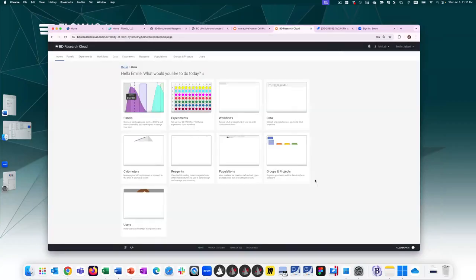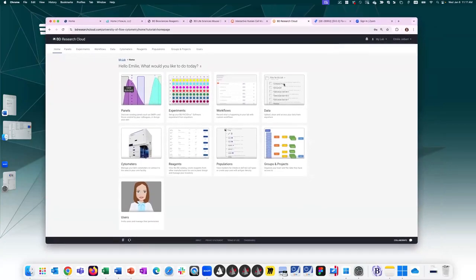Okay, so by logging into BD Research Cloud, you arrive on the homepage. The homepage shows different tiles of the different sections. So there's a lot you can do within BD Research Cloud. Today, we're going to focus on panel creation, but just very briefly, you can not only view and create panels, but you can create FACS-DIVA experiments away from the cytometer. You can create customized workflows to keep track of who did what in the lab with timestamps and tasks assignments. You can upload data directly to BDRC with connectivity to FlowJo to analyze your data from anywhere.